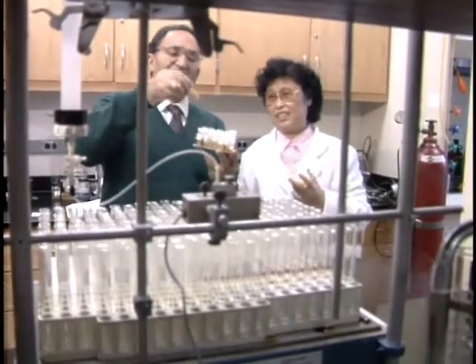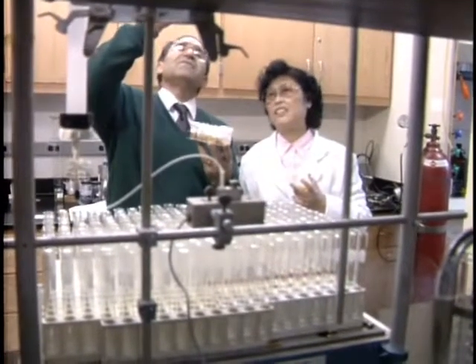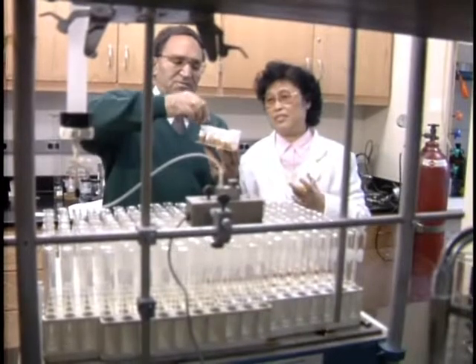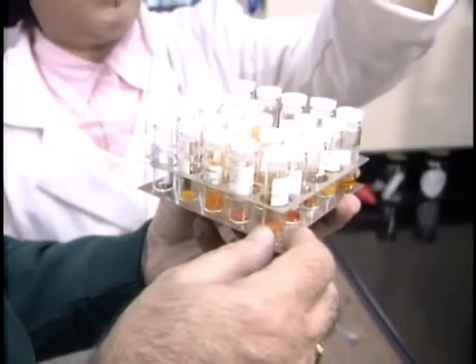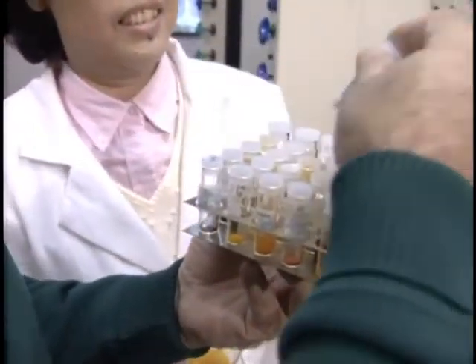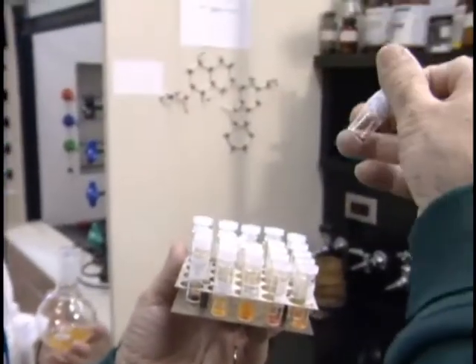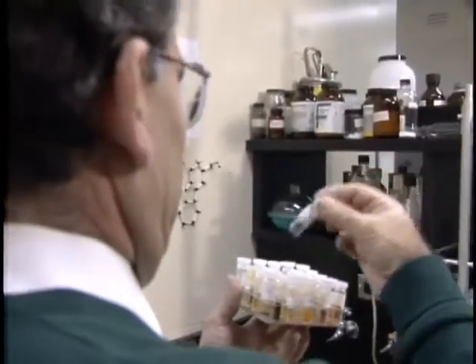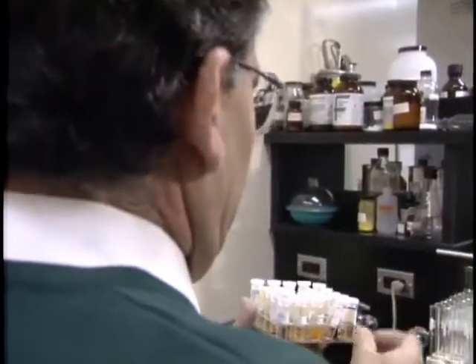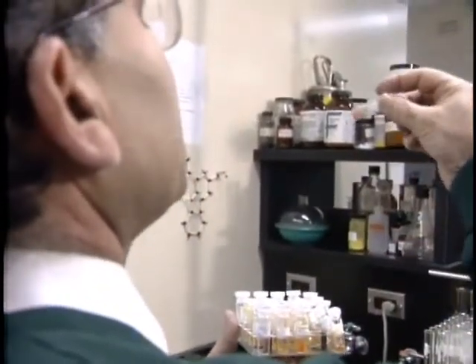So these are the examples. How many milligrams do we have here? Maybe 20 milligrams. These are pretty colored. This is all the products. And then we have these crystals here. Very pretty crystals. All these are nice also.